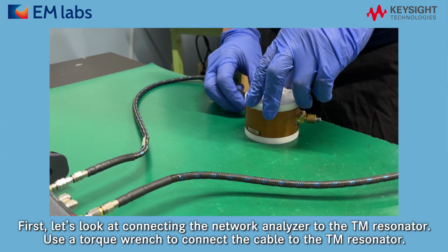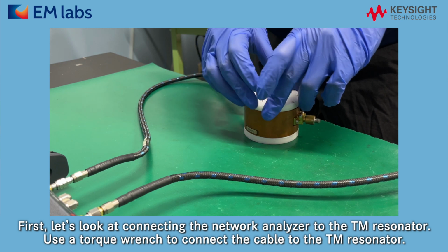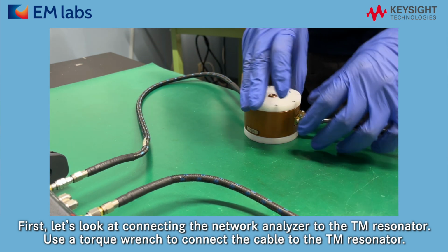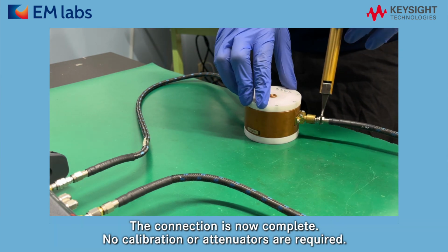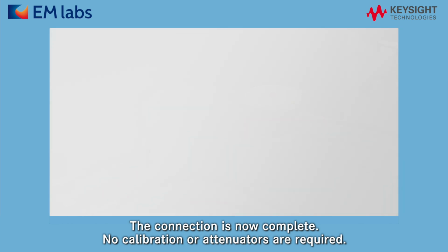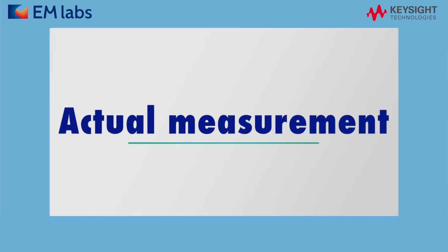First, let's look at connecting the network analyzer to the TM Resonator. Use a torque wrench to connect the cable to the TM Resonator. The connection is now complete. No calibration or attenuators are required. Now let's move on to the actual measurement.